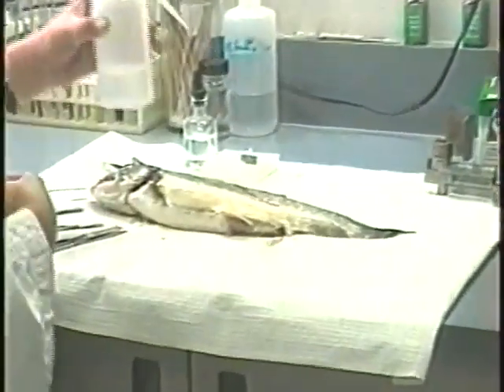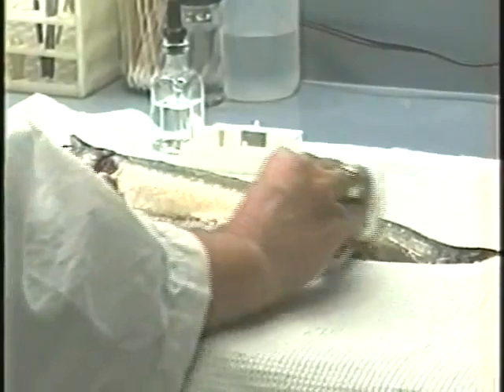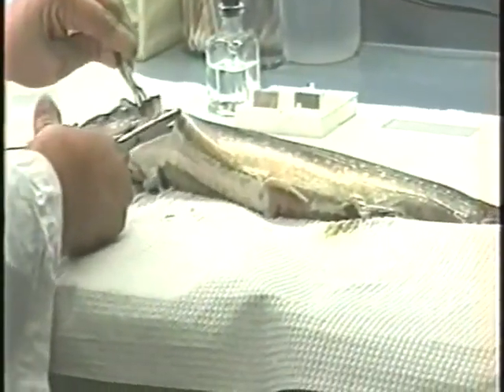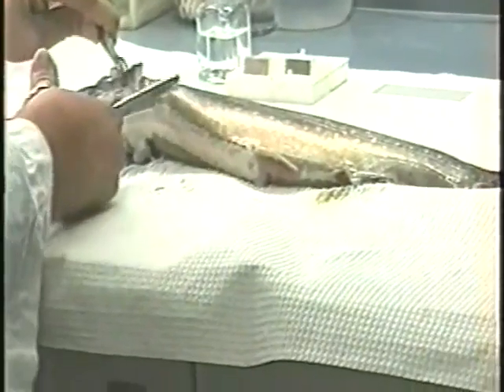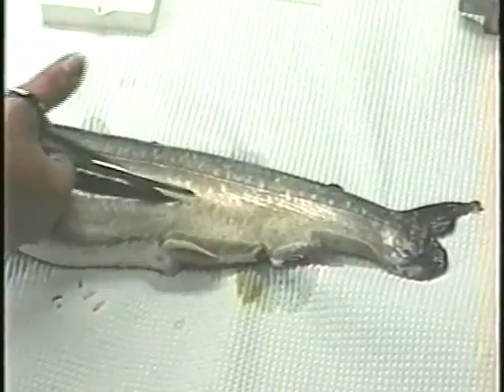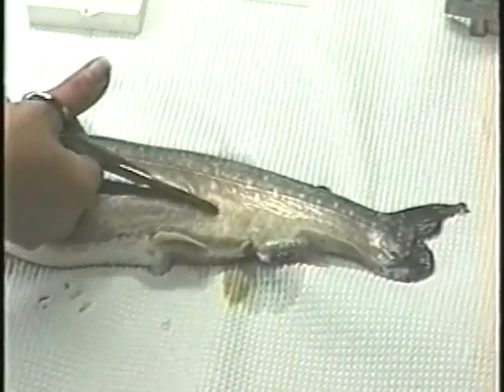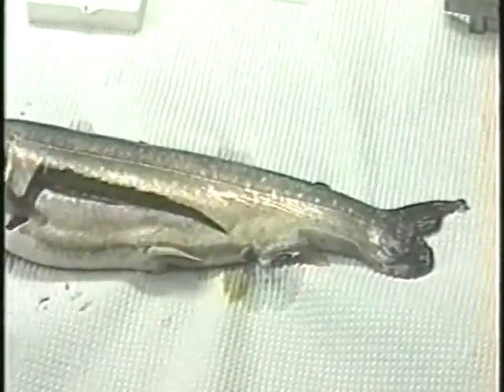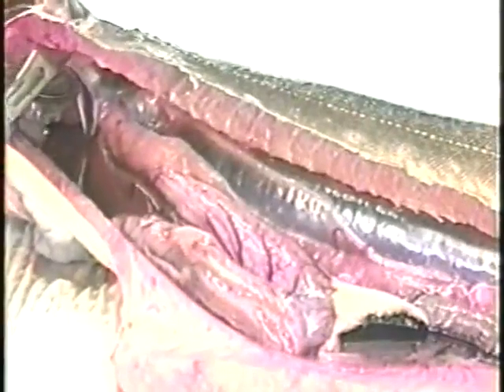First, disinfect the body surface with 70% alcohol or iodine and open the body cavity using either sterile scissors or a scalpel flamed in alcohol. Make an incision above the pectoral fin and cut along the swim bladder to the vent. The body wall may be held back or completely removed. While cutting, be careful not to damage or rupture any of the internal organs.